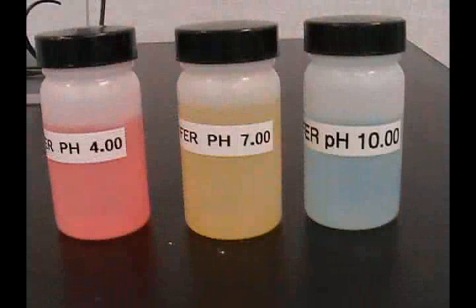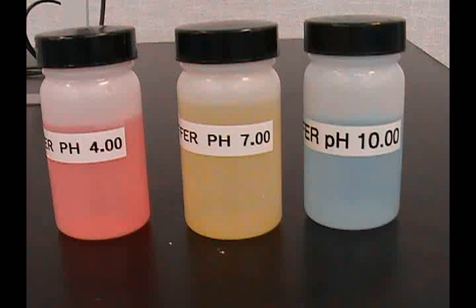To calibrate the meter, acquire two or three buffered standards. They should be 4, 7, and 10.